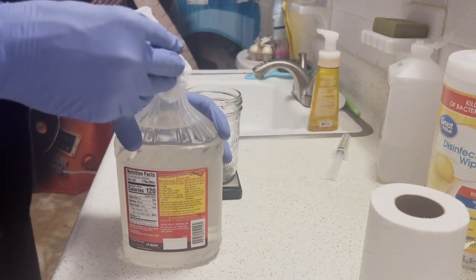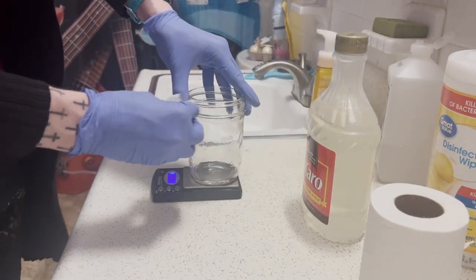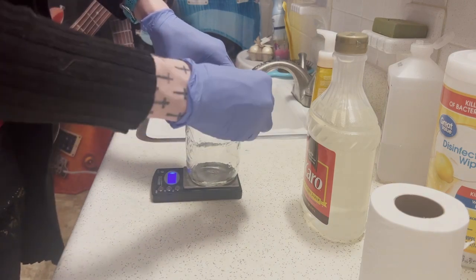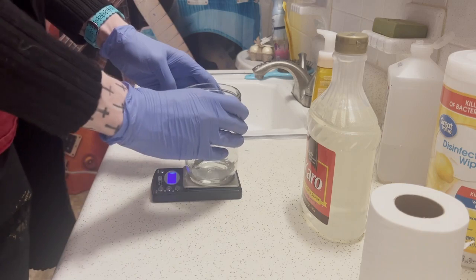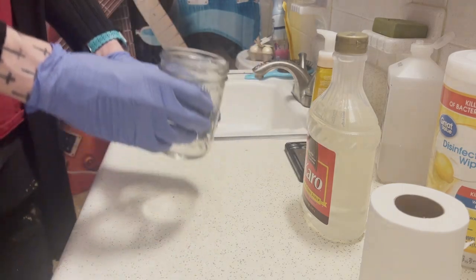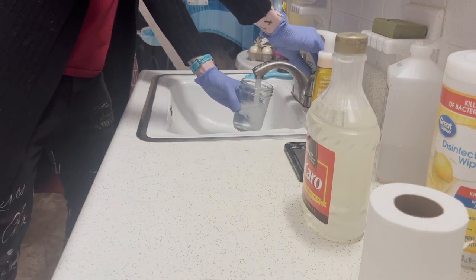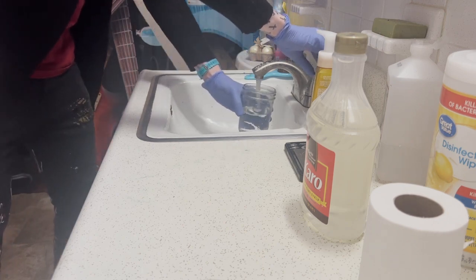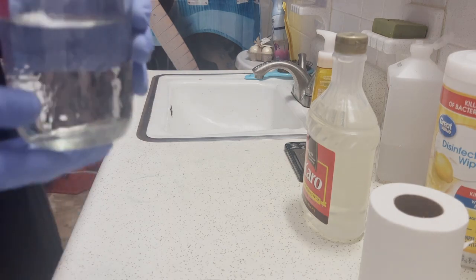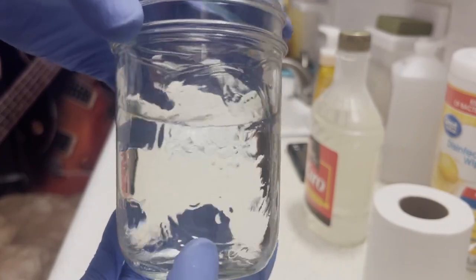I'm a little bit messy, so I'm going to go ahead and clean up the excess corn syrup around the edge and on the rim of the glass. Once this is done, I'll turn off my scale. Then I'm going to fill up my mason jar with 300 milliliters of water — if you're using the smaller mason jar like I am, that's about 75% full. And now you can see this is our mixture. This looks pretty nice and clean.